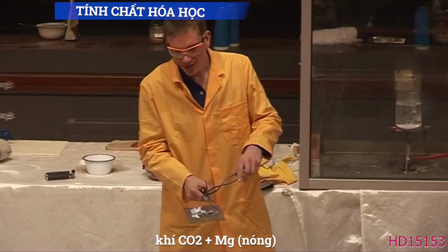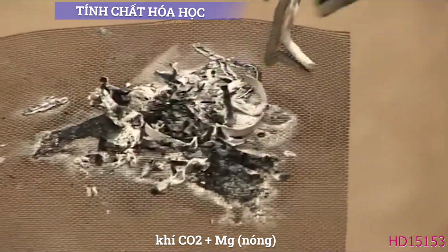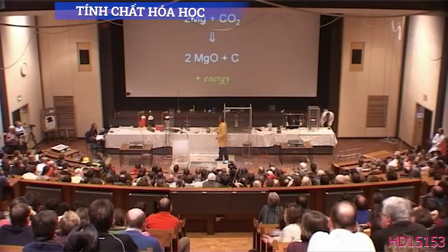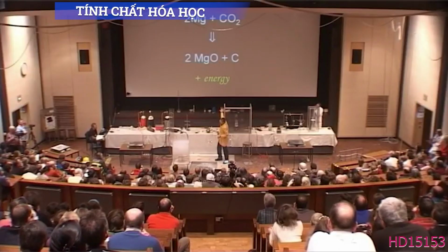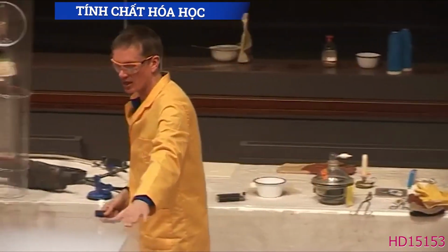We see some white magnesium oxide, but deep inside here there's a lot of black, and this black is carbon. Magnesium reacting with carbon dioxide, so Mg is the magnesium, and carbon dioxide reacts together to form magnesium oxide. The magnesium steals the oxygen from the carbon dioxide, leaving behind the black carbon and also releasing energy. So the magnesium burns in the carbon dioxide.